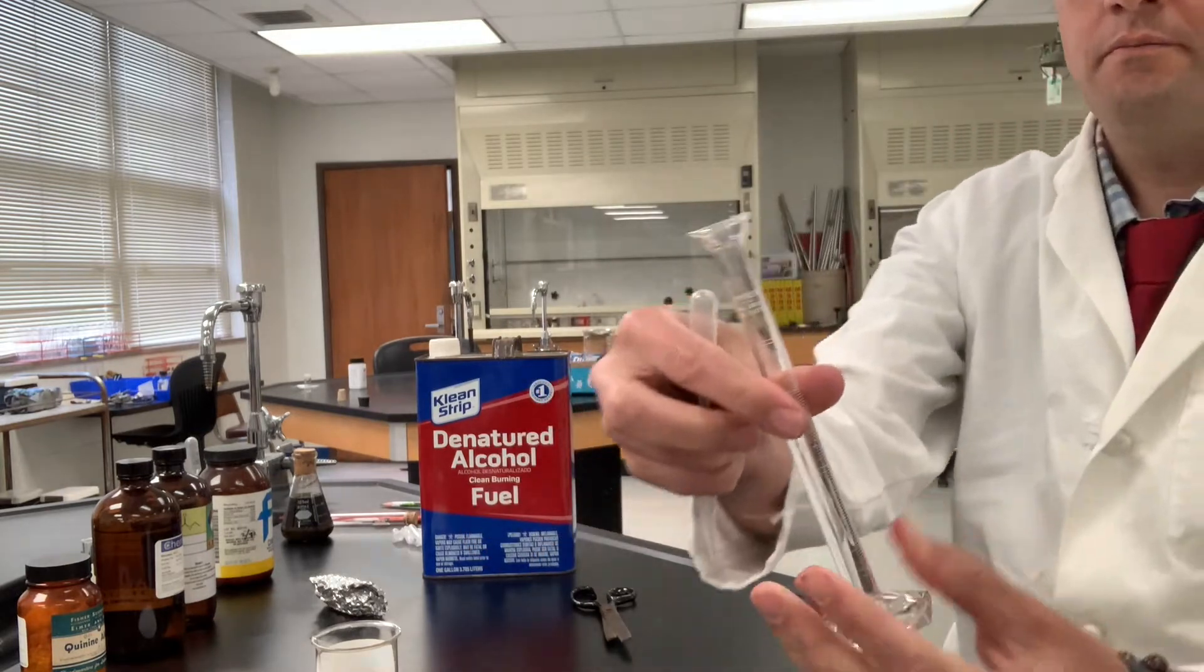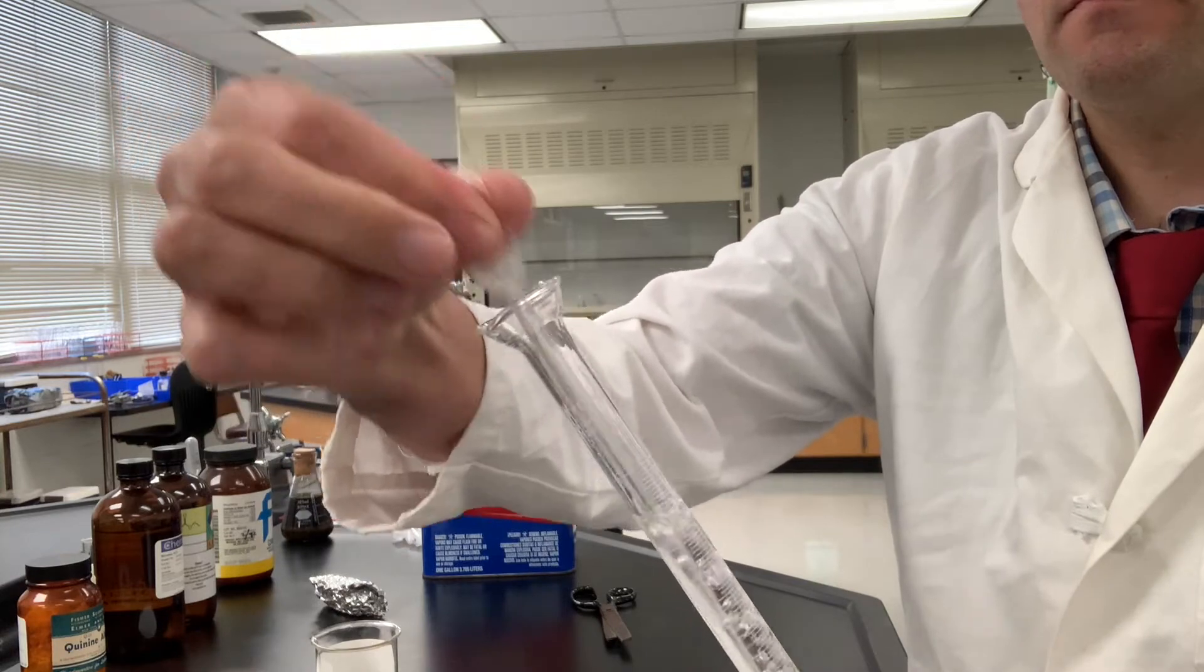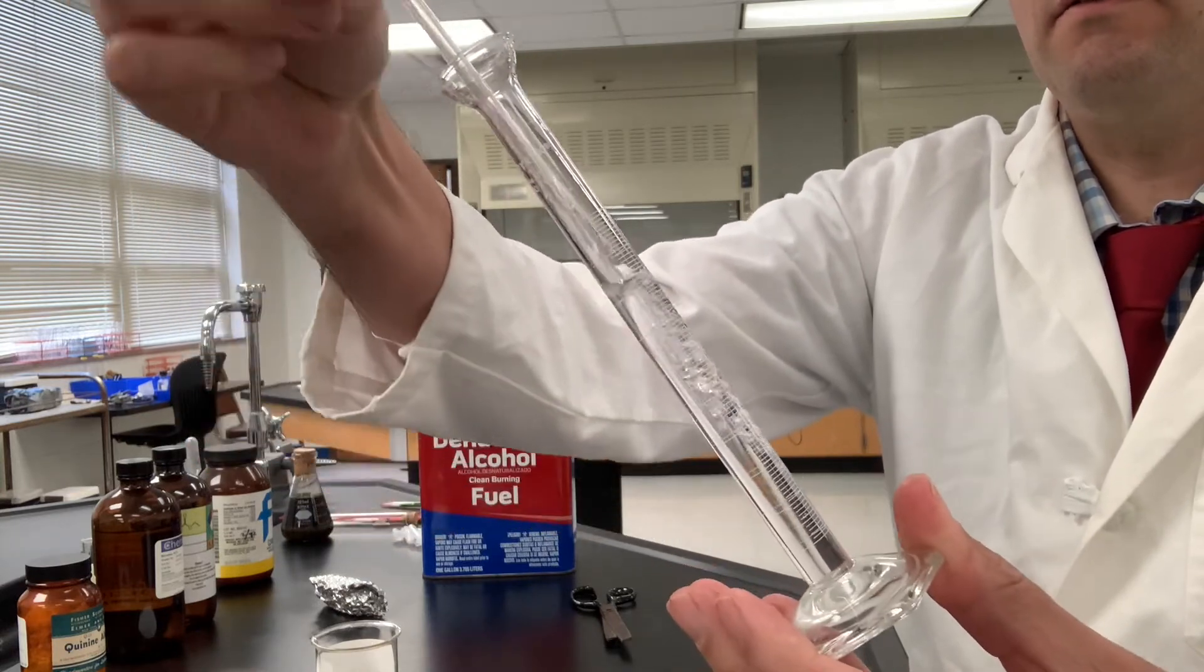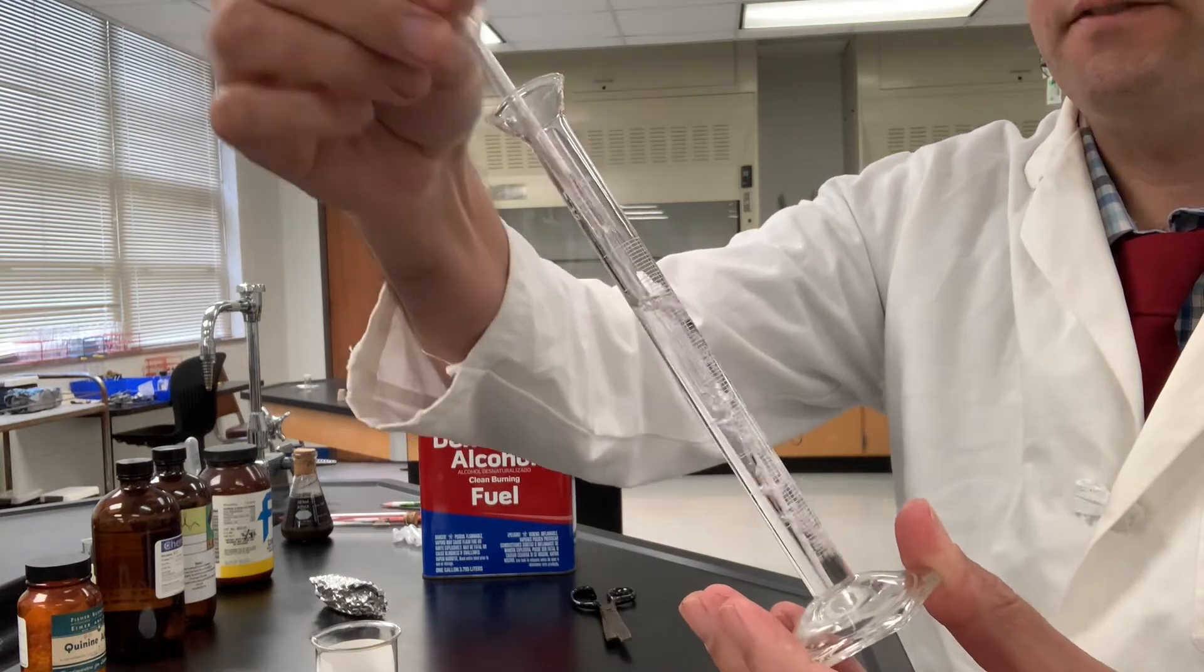So what I normally do to mix this up is just aspirate and squirt it in there four or five times.